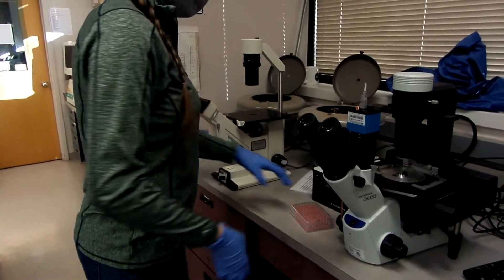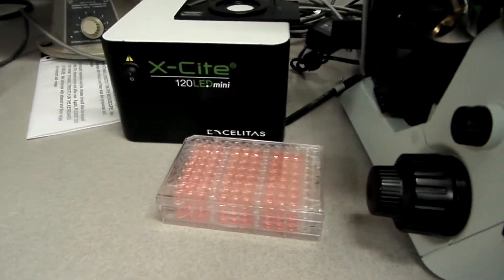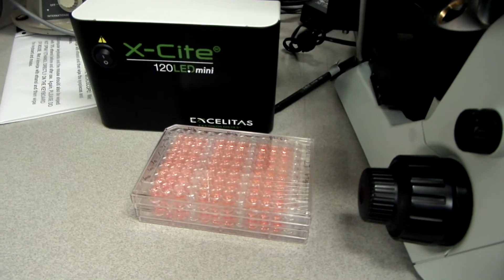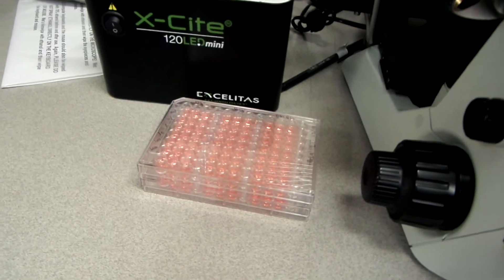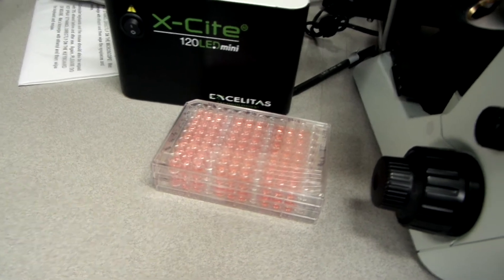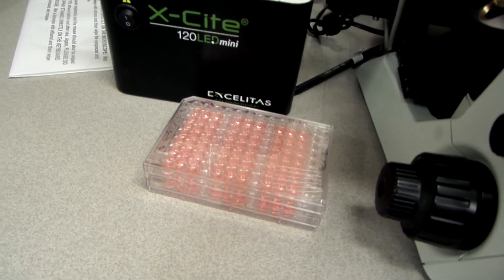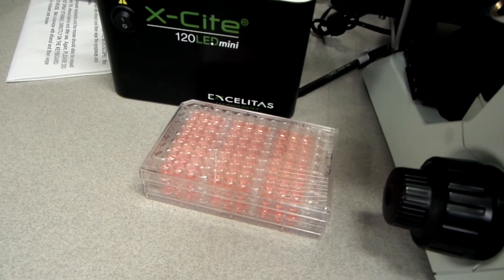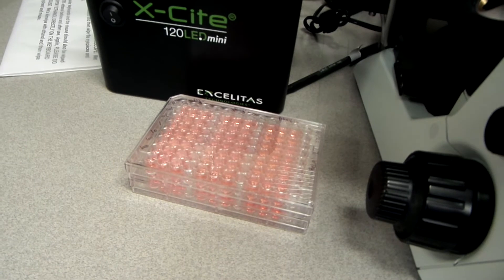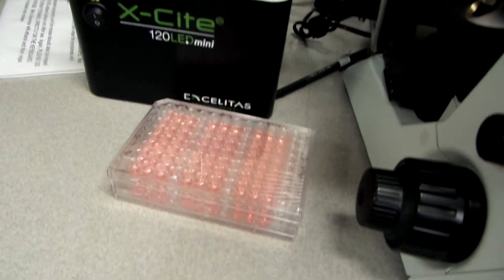The cells are grown in 96-well plates and then treated with different treatments — either one drug at different concentrations, or different constructs for a protein that is either down-regulated or overexpressed — for the amount of time that you have specified.